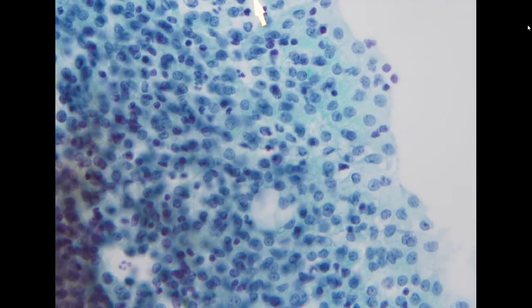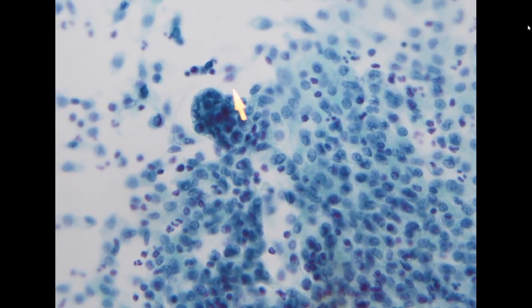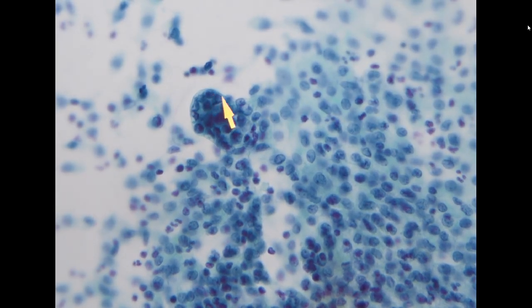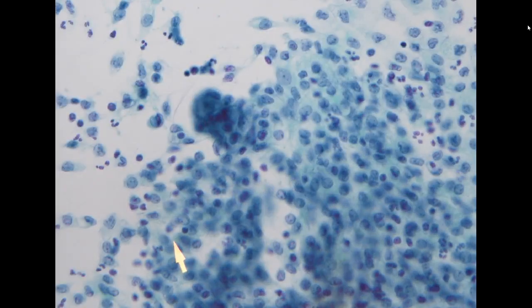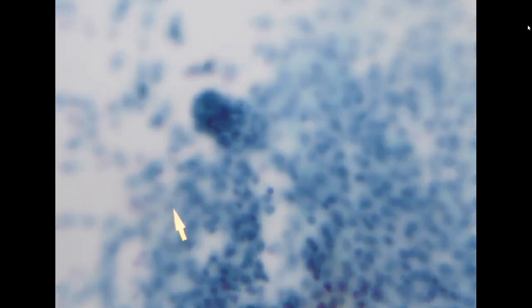Here you can see mesothelial cells or reactive lymphocytes, and here you see a three-dimensional cluster. Pancreatic adenocarcinoma usually has lower grade nuclear features. Compared to the enlarged primary lung adenocarcinoma, here the size of the nuclei is basically similar or even smaller than the mesothelial cell. However, you can appreciate this is a three-dimensional pattern, which is a sign of metastatic carcinoma.